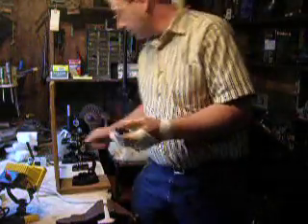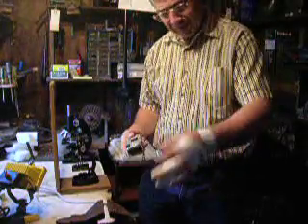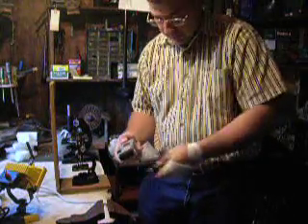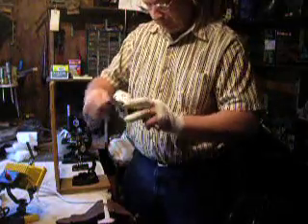Then with a digital camera, if you own a digital camera, you buy one of these. These are like a camera clamp. You can get them from L.L. Bean. That's where I got this. It was like $7. And you just attach the camera to it.